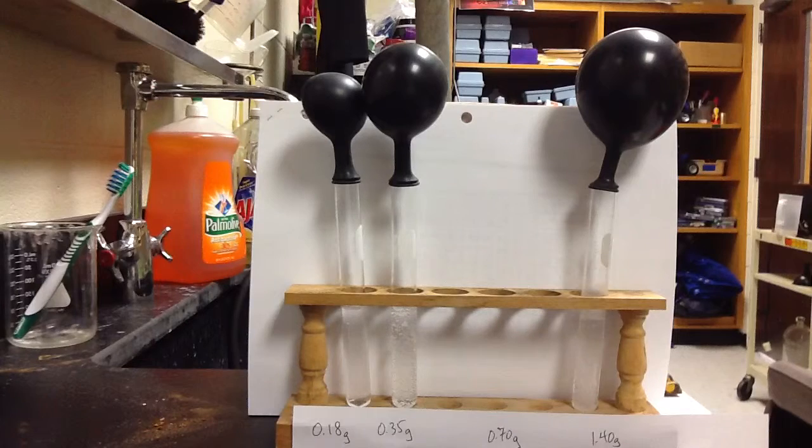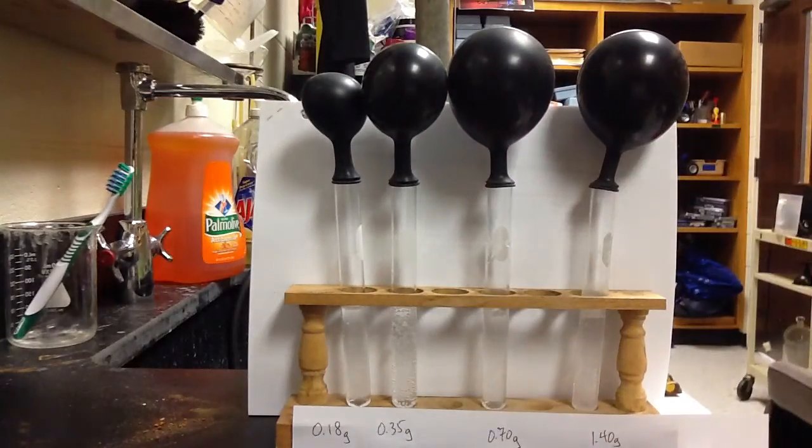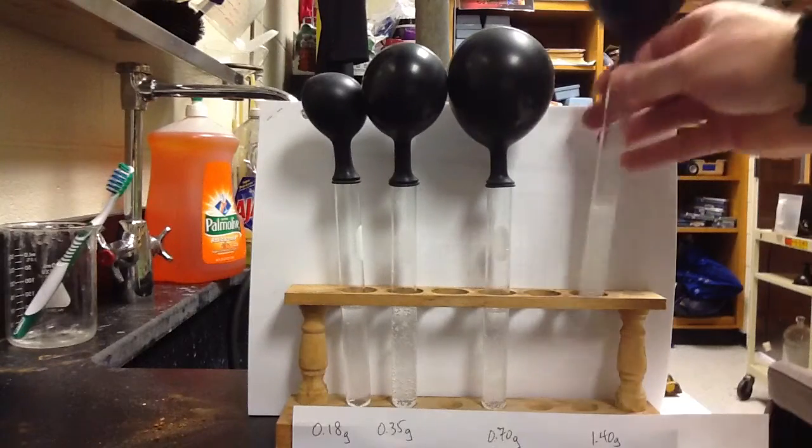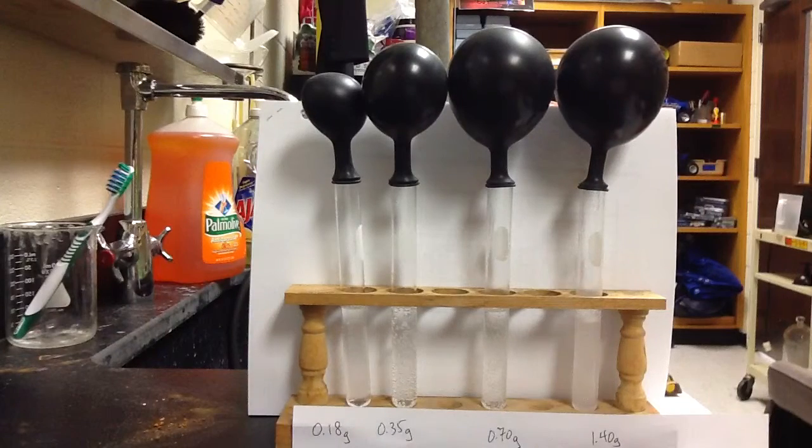Something to think about is, in a reaction like this where you're producing a gas, how would you know if the reaction is done? When I invert that and mix it again, how would I know that the reaction is done? Maybe pause the video or take a couple moments to think about that. All right, one way we would know that the reaction is done is by looking for bubbles, because the gas is being produced. If the reaction is done, then we wouldn't see any more production of bubbles in there.